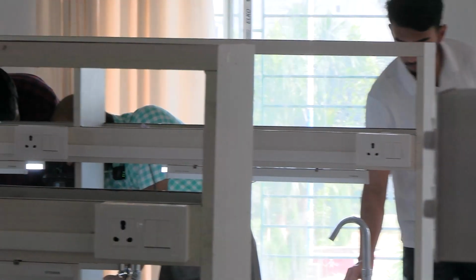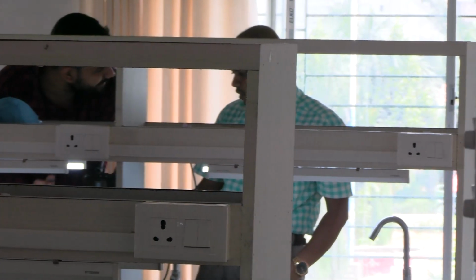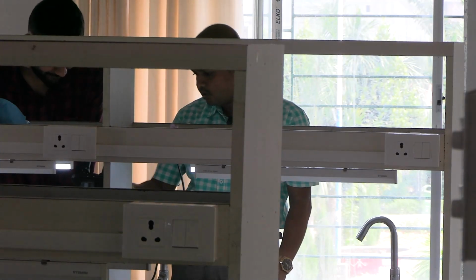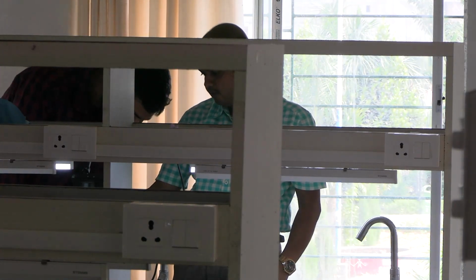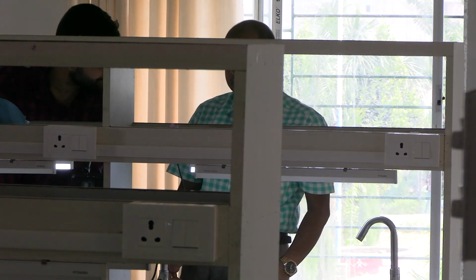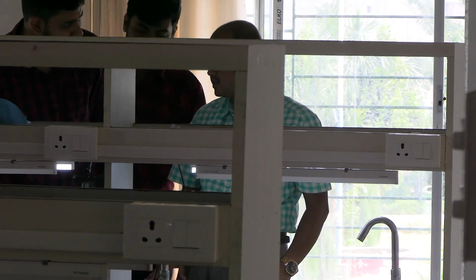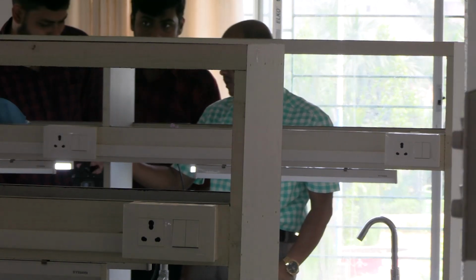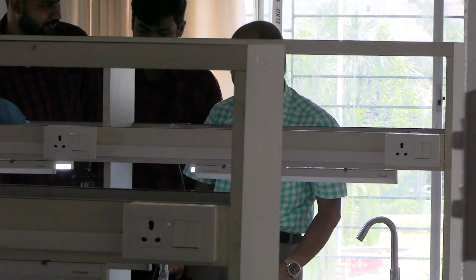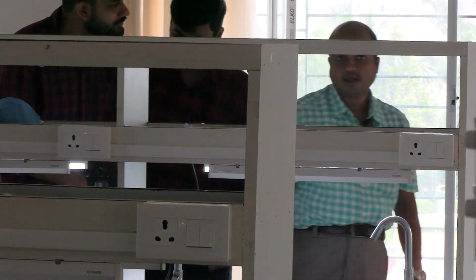But sir, how did you... So how did you? This is just by trial and error. Use the coarse adjustment screw. So you have to take the stage down, and then bring it up towards the lens. Okay, I am sorry, I just told the opposite. You take it away from the lens, because if you bring it towards the lens, the lens may touch it and break it. So keep it here and then move it away from the lens and see where it gets focused.